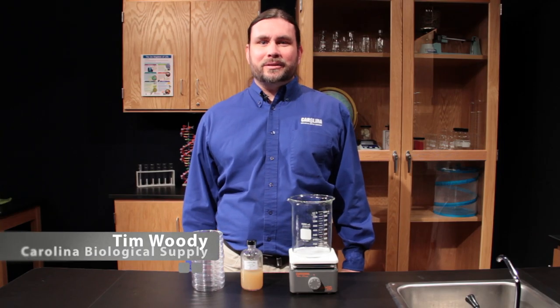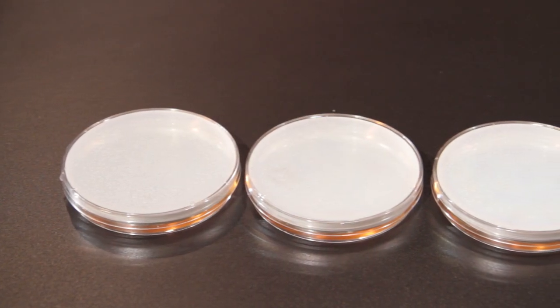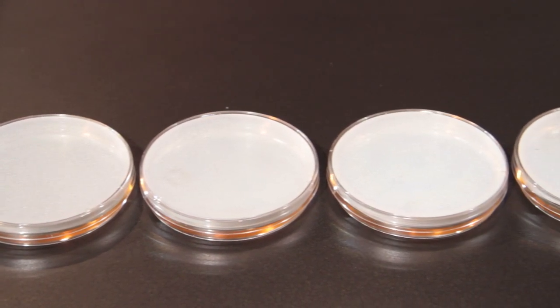Hi I'm Tim Woody, a biologist with Carolina Biological Supply Company. Today I'll show you how to melt prepared media bottles and pour plates.